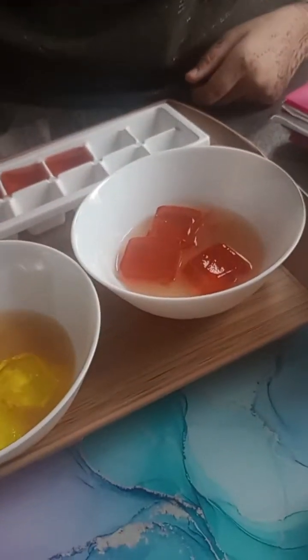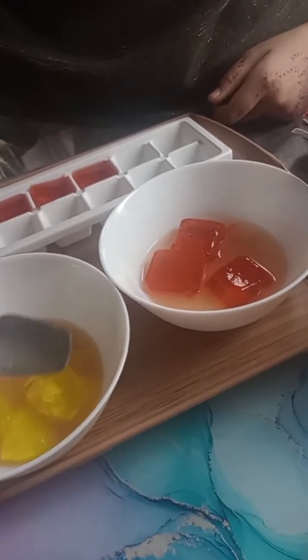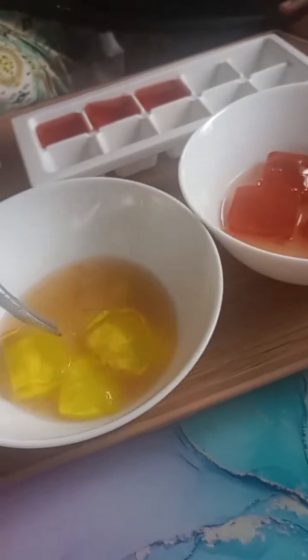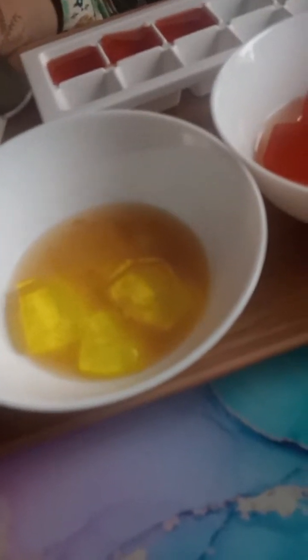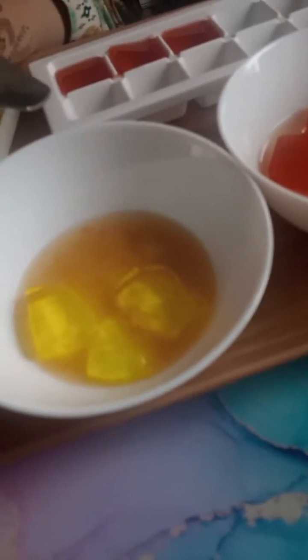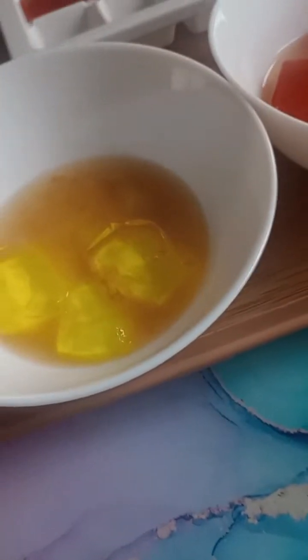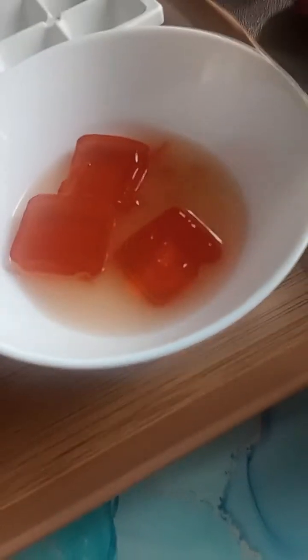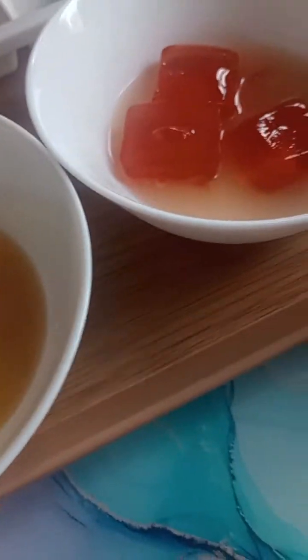That's what it is. So by science, what we're trying to say in GCSE, the conclusion we came out with is that the smaller jelly cubes, which is the yellow one, the pineapple one, allow the acid, the apple cider vinegar, to diffuse all the way through much faster than the larger cubes. So the red ones are the larger cubes. Okay, so this shows us how cells need a large surface. So we know now that cells need large surface.